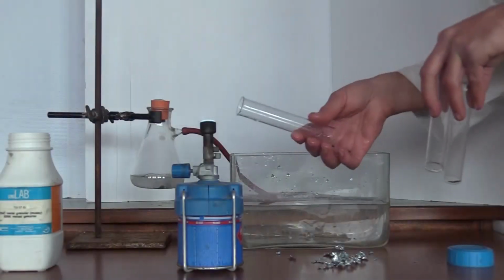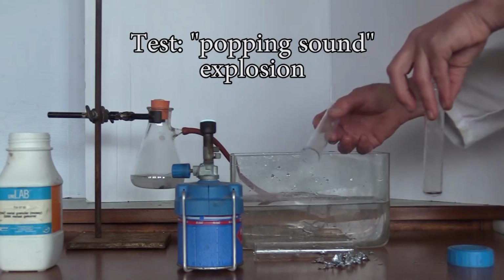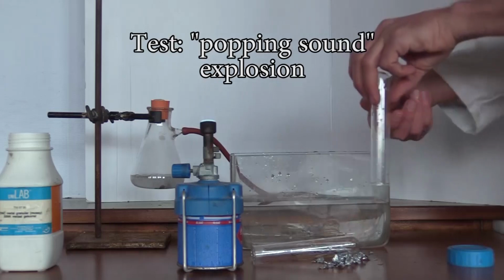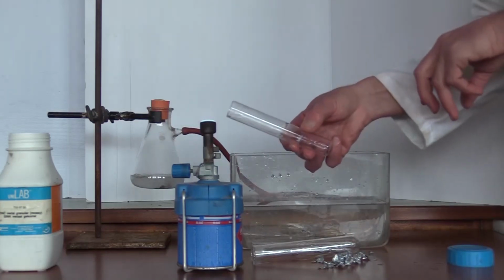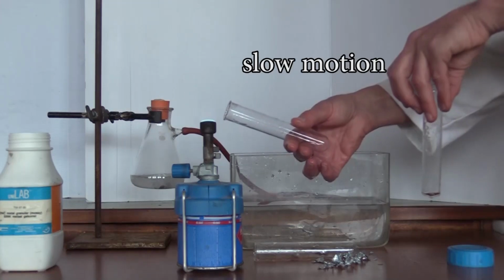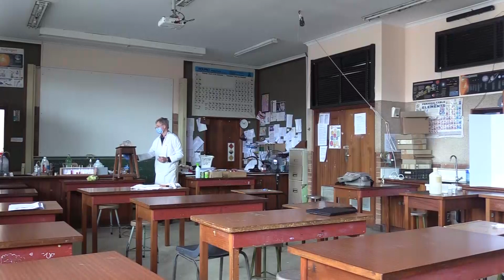And then when we test it, we explode it. It makes that characteristic popping sound. Let's look at that in slow motion again. Notice how the flame jumps into the test tube. And a larger amount.